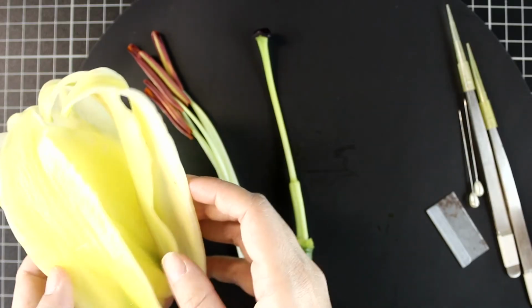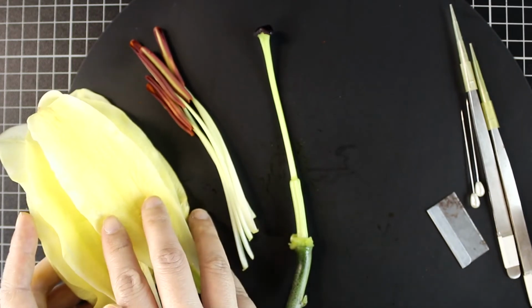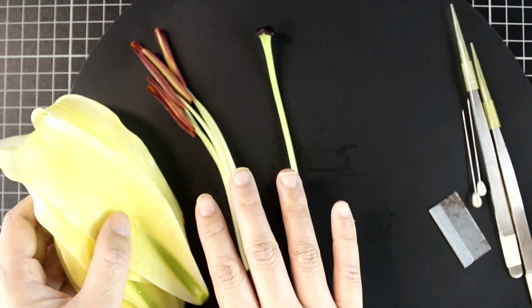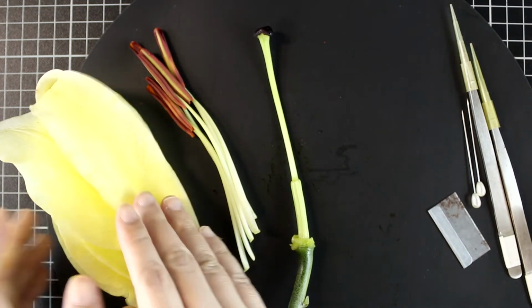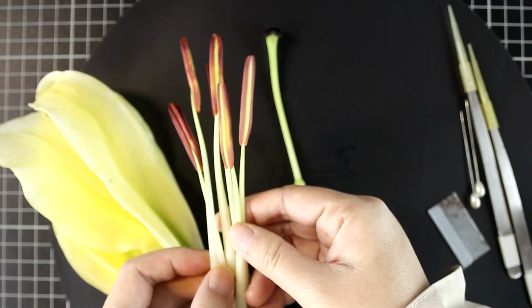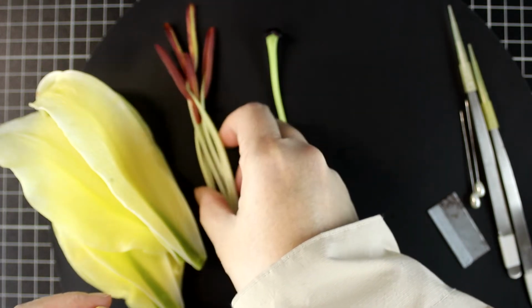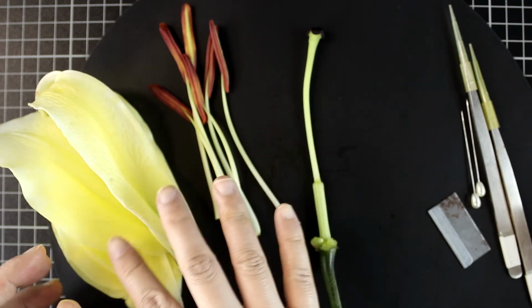There are 6 parts for the perianth, so P should be 6. They're not fused, they're not connate, and they don't fuse with other tissue too. So you don't need the bracket. The stamens are also 6. There is no connation or adnation. They don't fuse with each other, and they don't fuse with other parts of the flower.